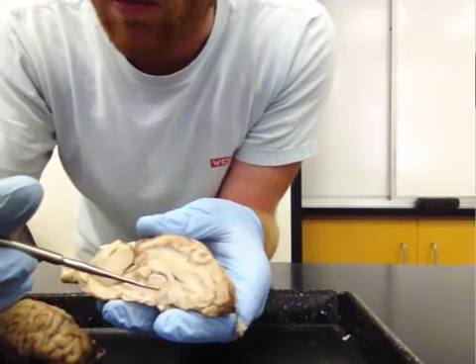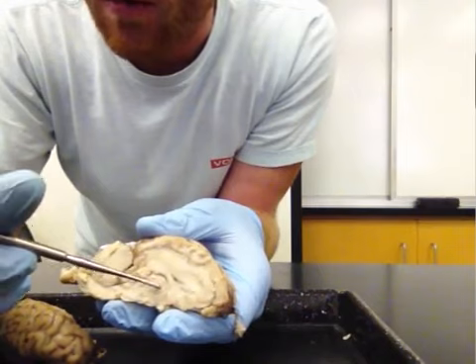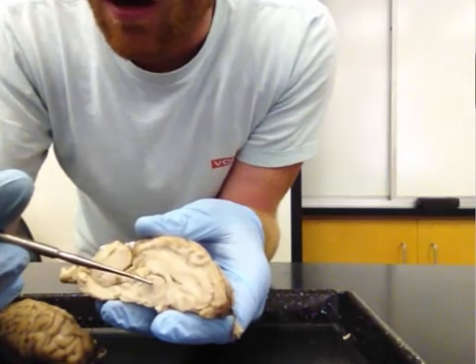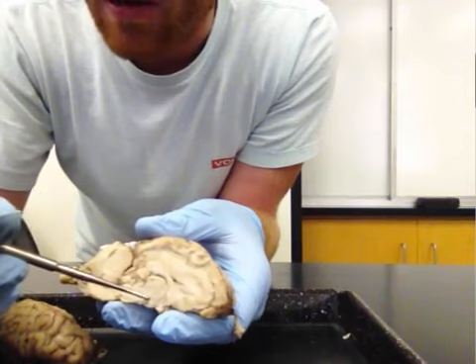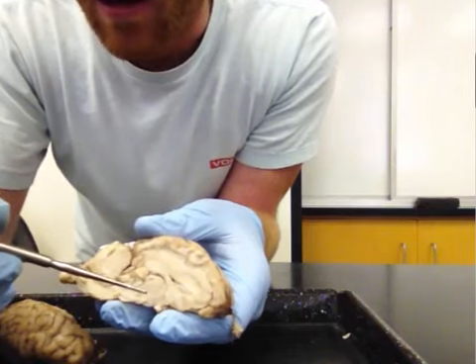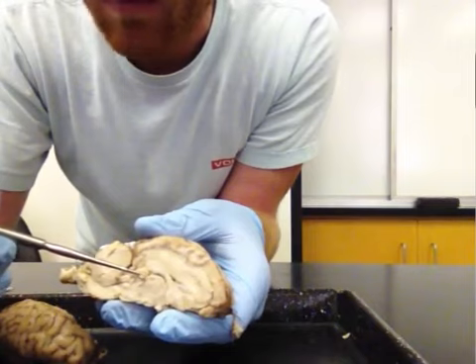So this is all between brain. And right in the middle, right here, is this large sphere. This is the thalamus, right here. Just below or ventral to the thalamus, we have the hypothalamus. And then posterior to the thalamus is the pineal body.